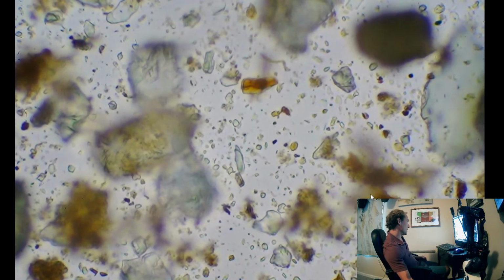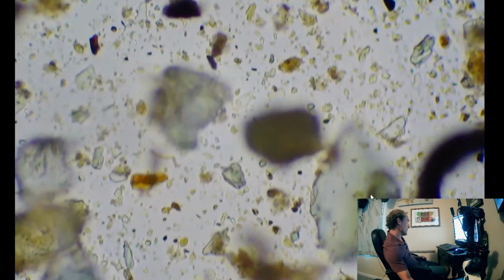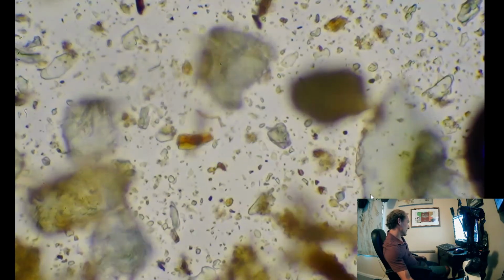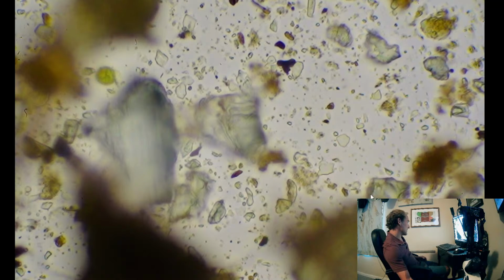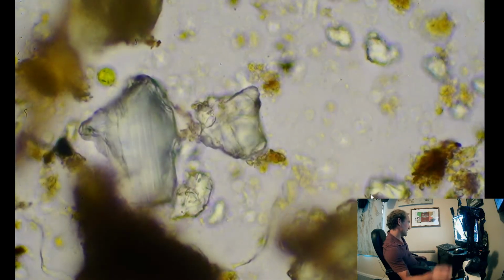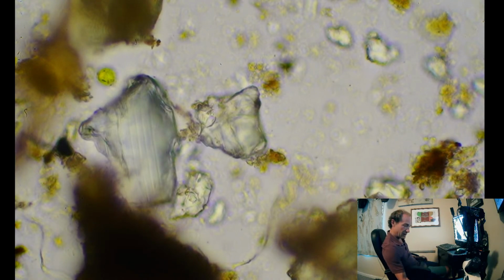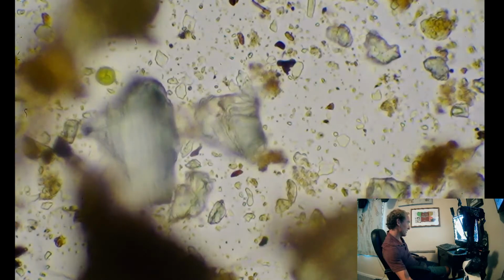Just small clear minerals that don't do much for the soil. Eventually they'll be broken down and aggregated and turn into these ones that have glomalin on them for the bacteria that are slowly reducing, and they'll eventually form aggregates.